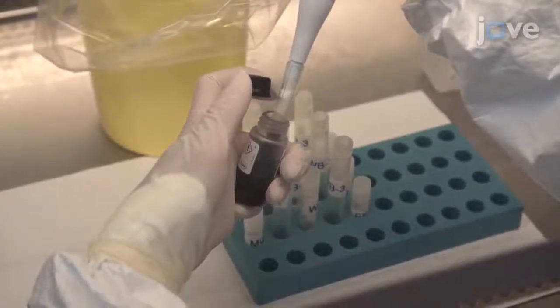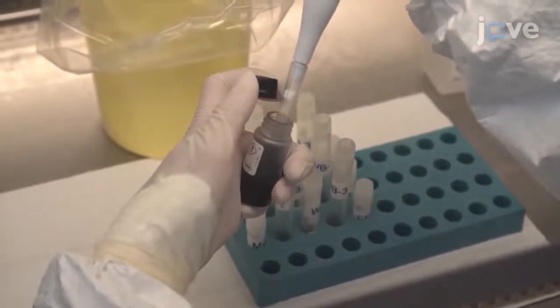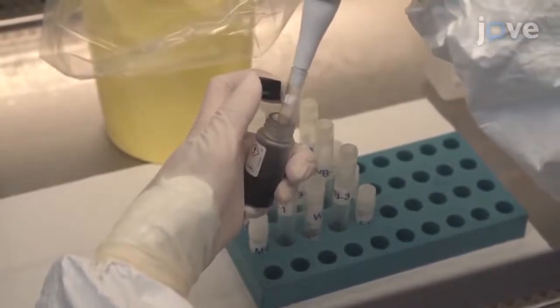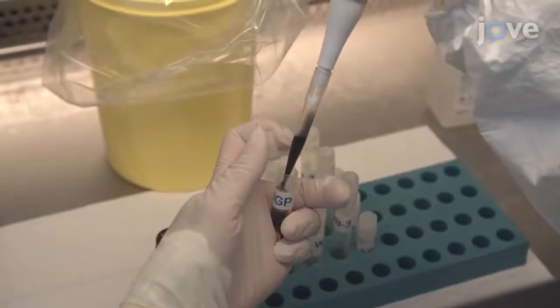Next, completely resuspend a 960-microliter volume of magnetic glass particles, or MGPs, and transfer to a labeled 1.8-milliliter tube.